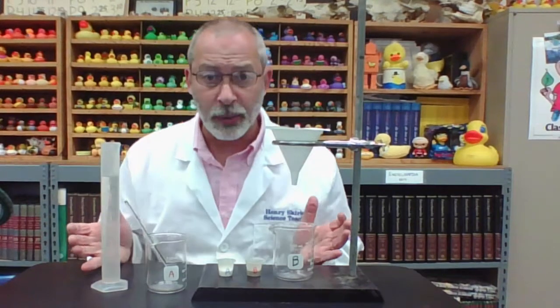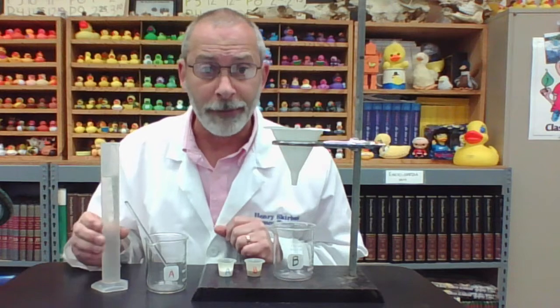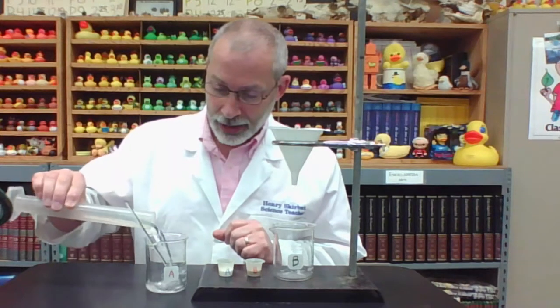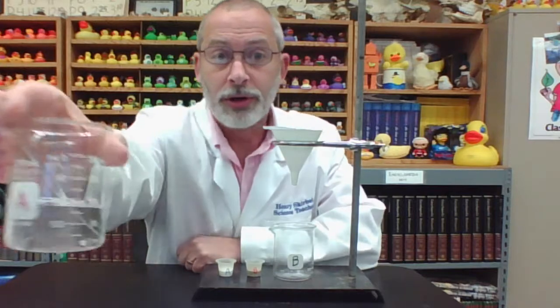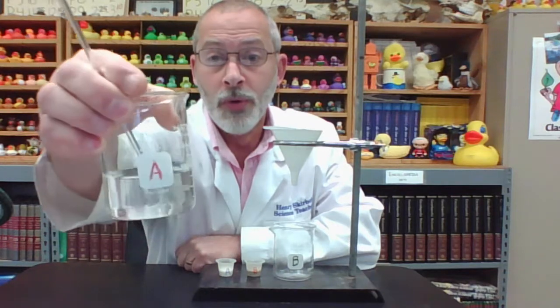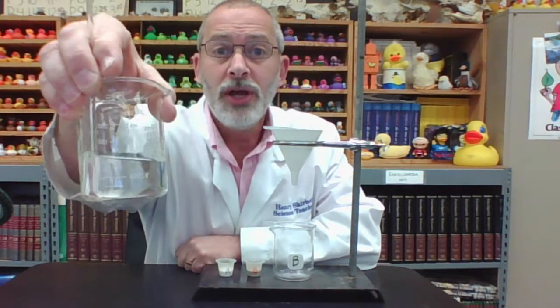All right, now that you're back, let's proceed with the lab itself. I have set up all of the materials that we need to conduct this lab, and we'll begin with step 2, which is to fill a beaker with 100 milliliters of water. I've already obtained 100 milliliters of water in a graduated cylinder, and I'll be placing it into our beaker at this time. And as we go through this activity, I will be holding the beaker closer to the camera so that you can see and make some observations on your own. So all that is right now in our beaker is 100 milliliters of water.